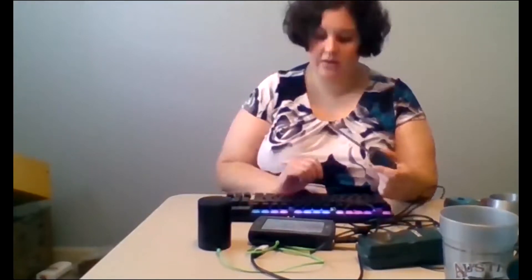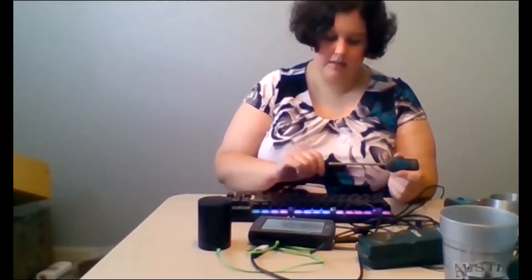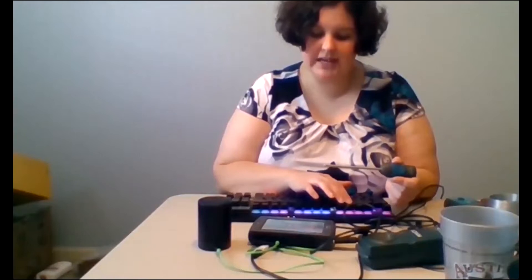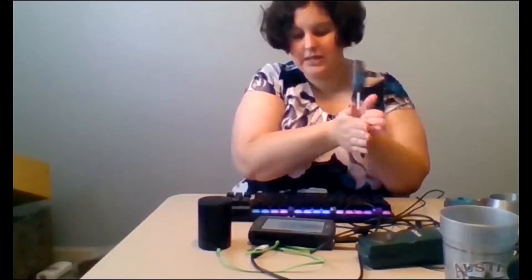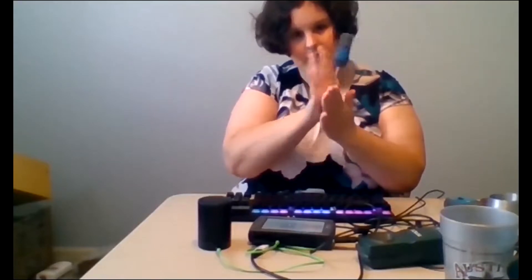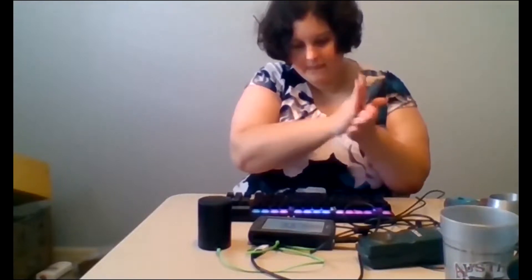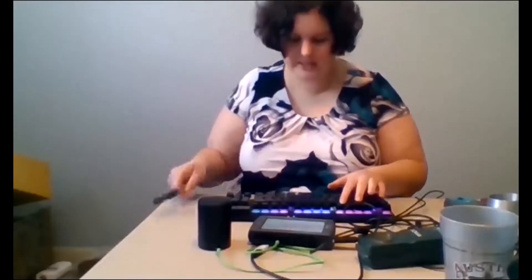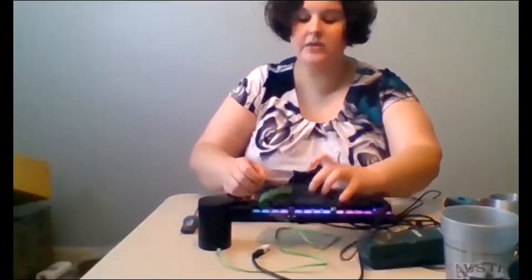The current readout will be announced every two and a half seconds. I'm going to press F3 to collect data, then rub my hands together to get the temperature to go up. We see readings of 24.0, 24.6, 25.7, 26.5, 27.1 degrees. Collection ended, and then we hit F12 to go to the next page.